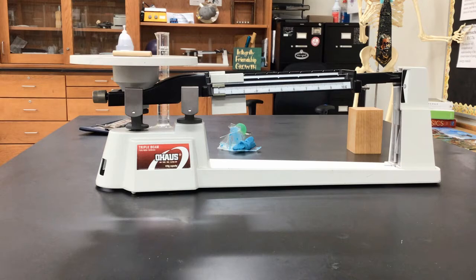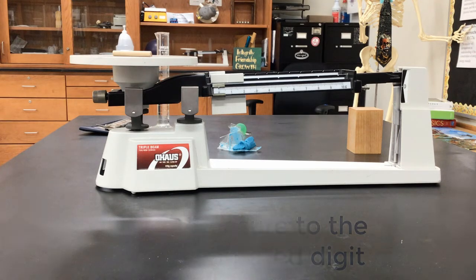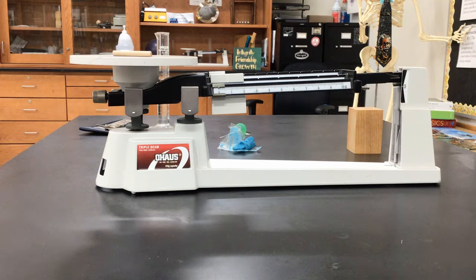And then you can see it's basically a ruler, and you know how to read a ruler. We've practiced how to read a ruler, how to get your estimated digit, and how to make sure you're using the proper number of significant digits from that estimated value as well. We can figure out our uncertainty. We've talked about that, and you have lessons and notes on that as well. Okay, so once we get the mass of all of our objects, we have everything we need to calculate density.